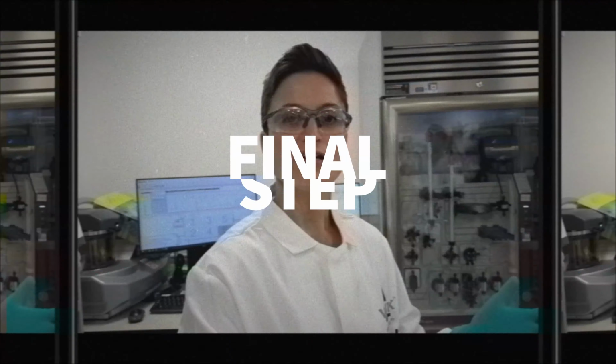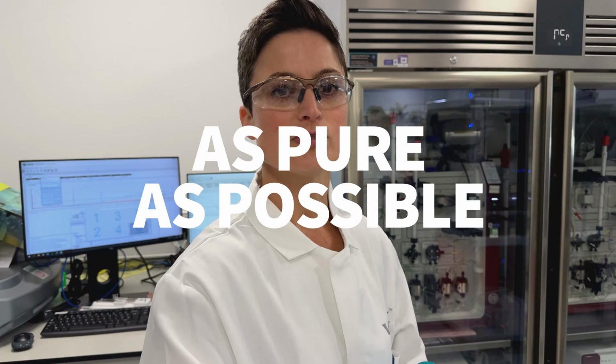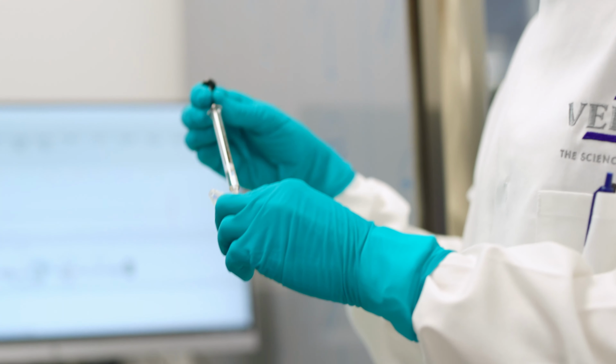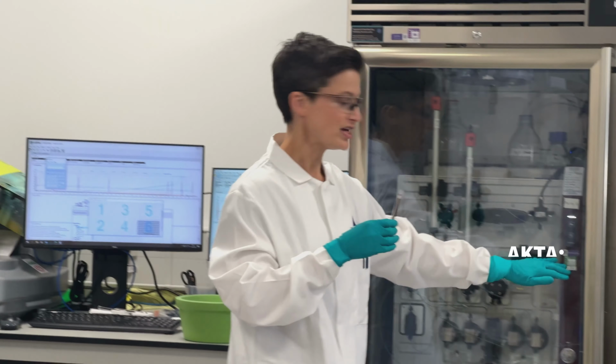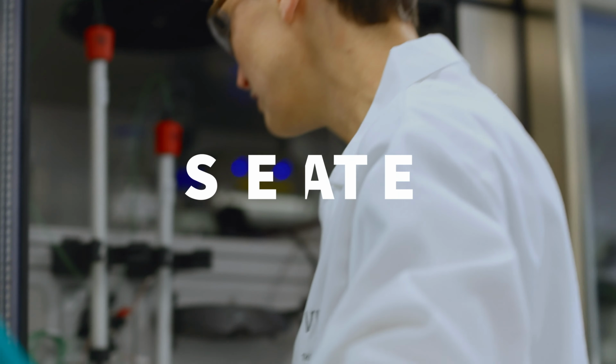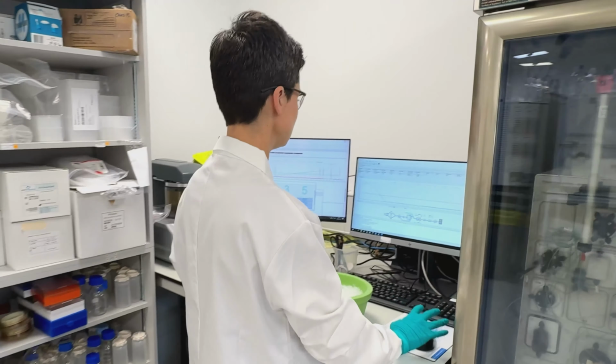So I'm at the final step of the purification of the protein. Before I hand over to Chady, I need the protein as pure as possible so that he can get a really good cryo-EM structure. So I've got my protein, which is partially purified, and now I'm going to inject it into the ÄKTA, which will separate all the proteins in the solution on the basis of size. And we've got about half an hour while it runs.